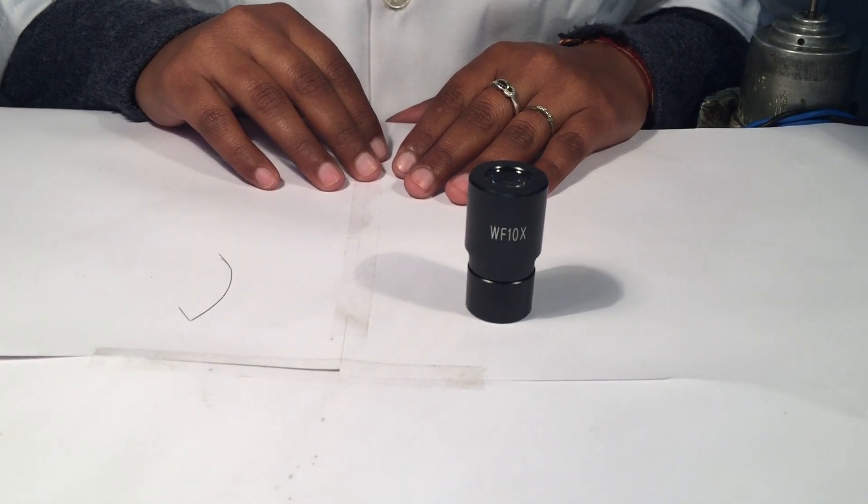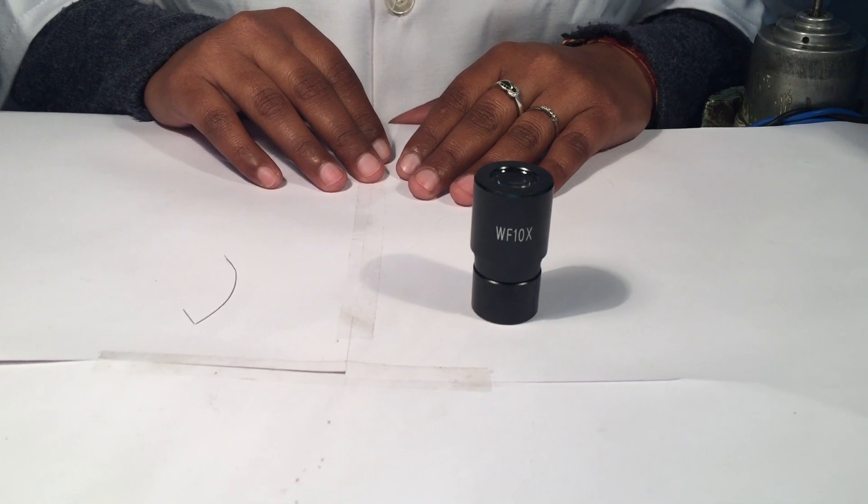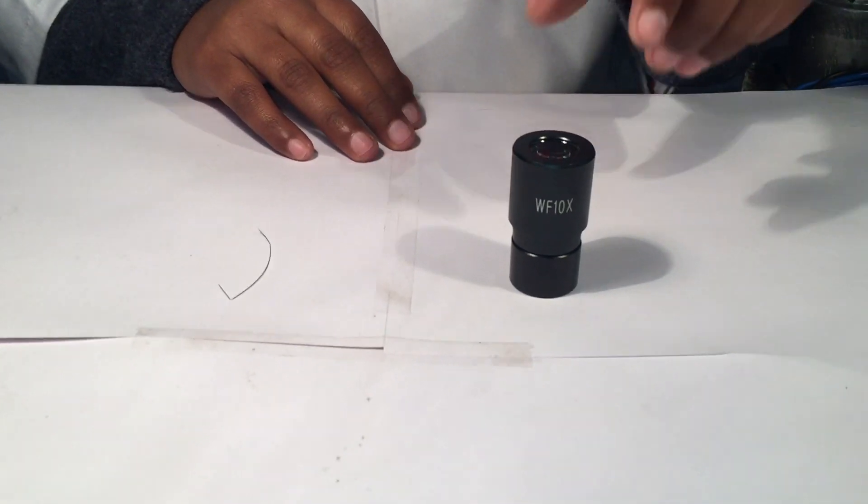Hello everybody. Now we'll show you the process of fixing the pointer on a WF10X eyepiece. Can we start the process?